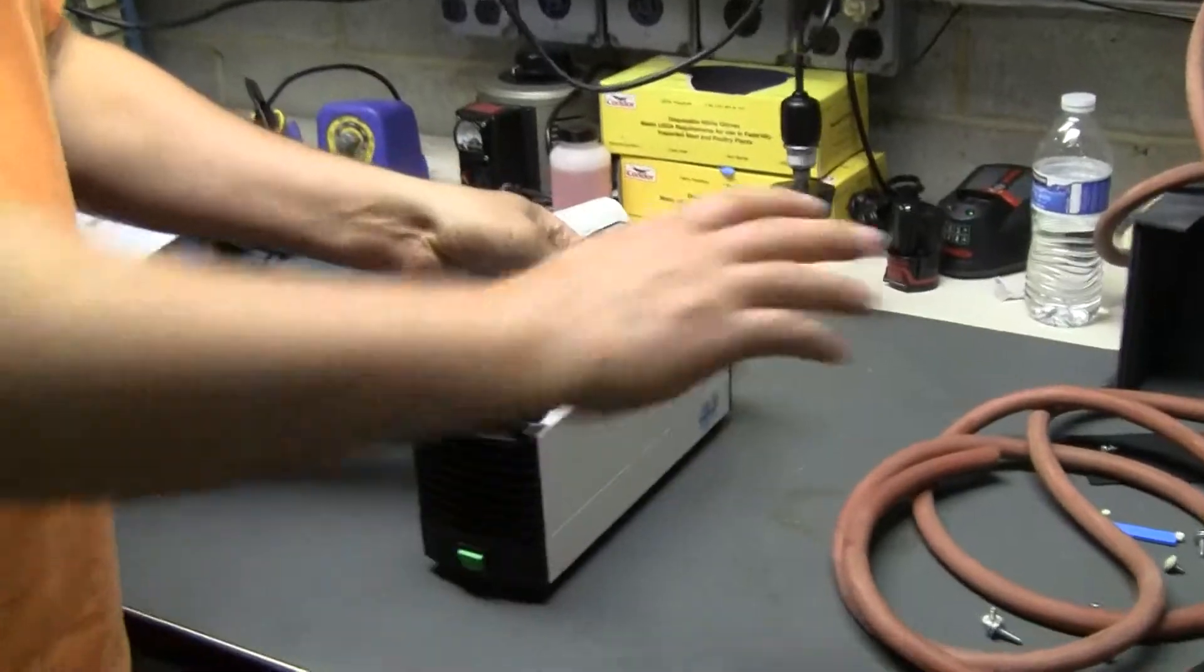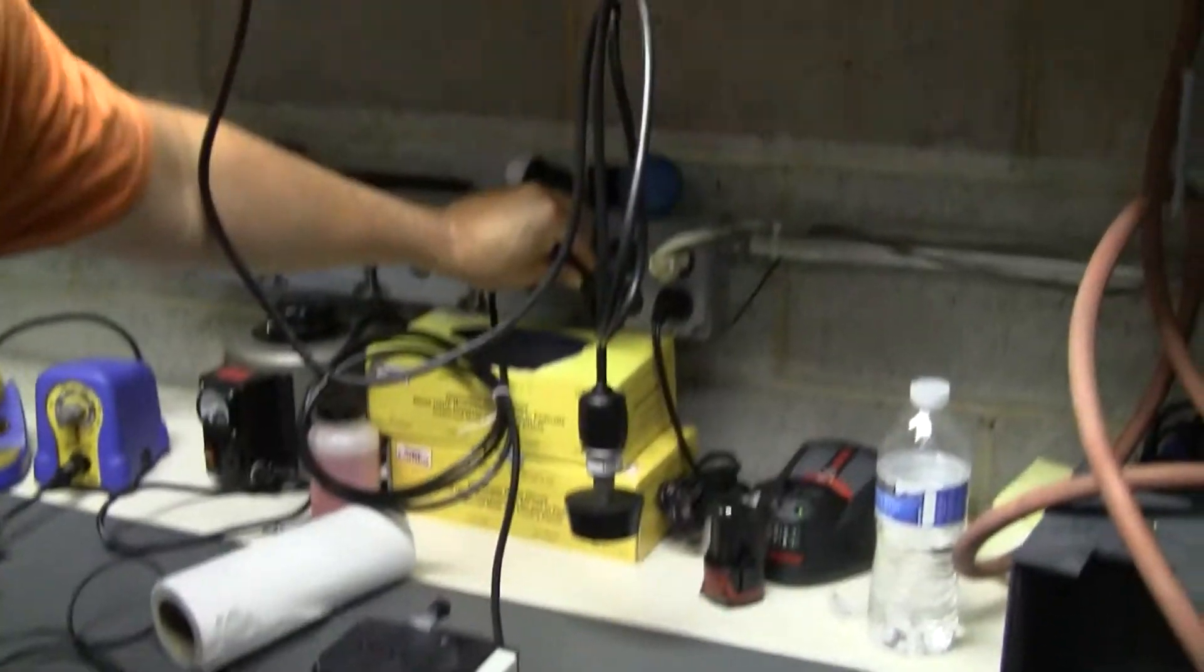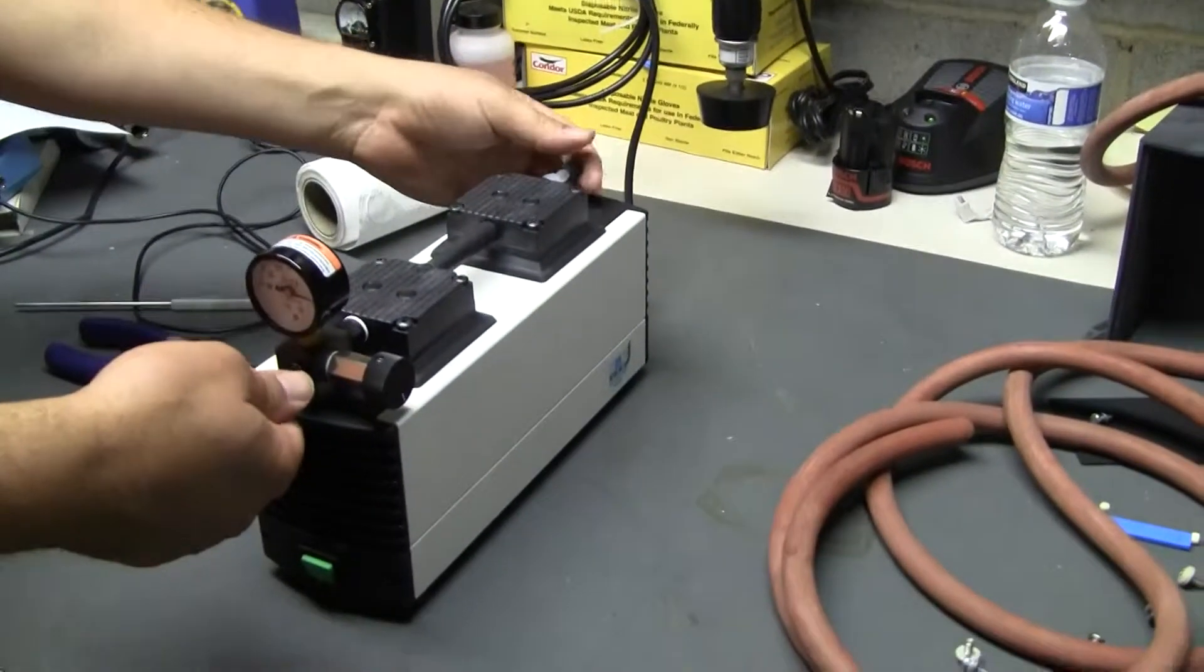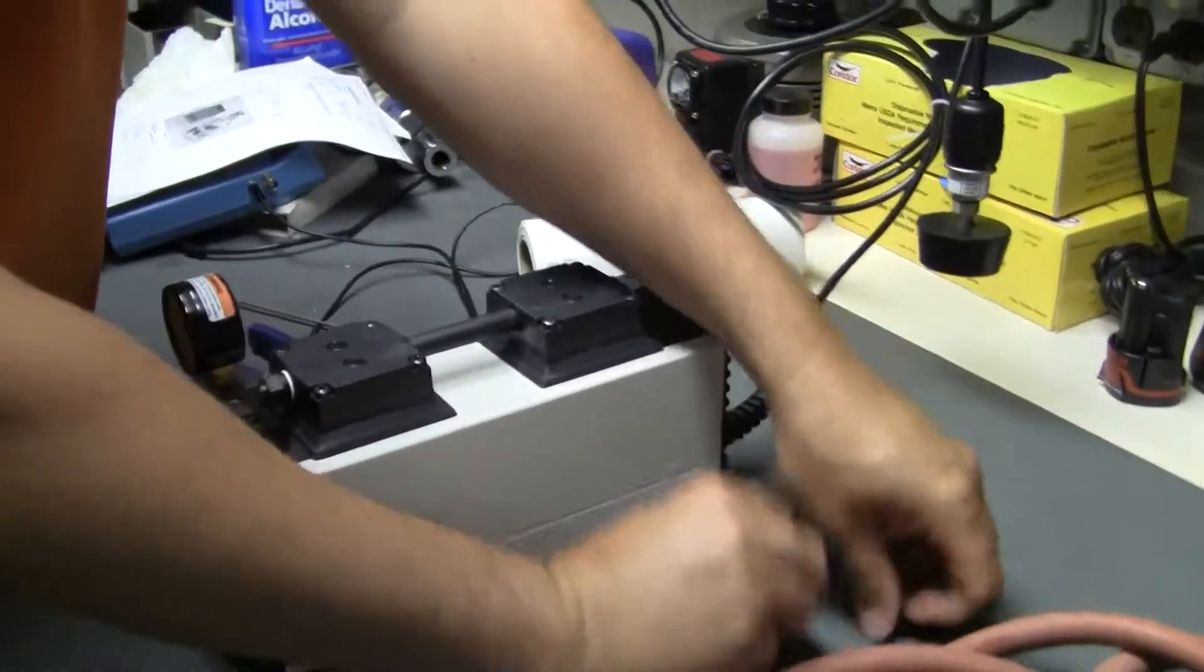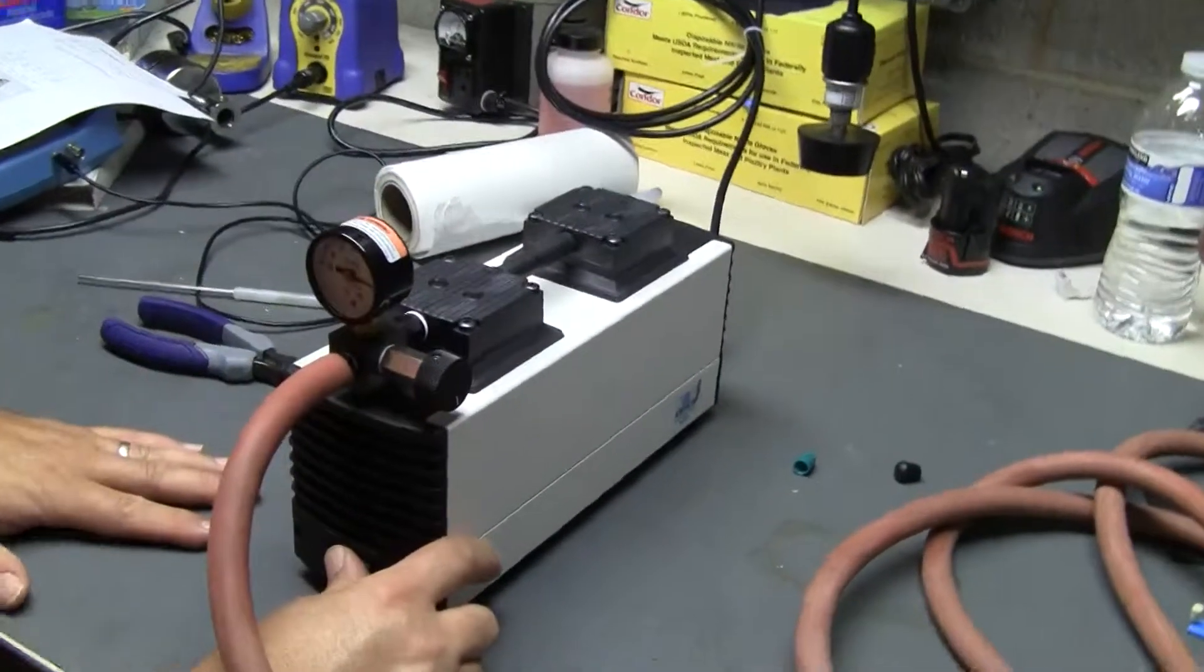Pull it out. We have our little test set up here. Plug it in. Take off the caps. I love new stuff. In the used equipment business, it is very hard to find, but let's do that.